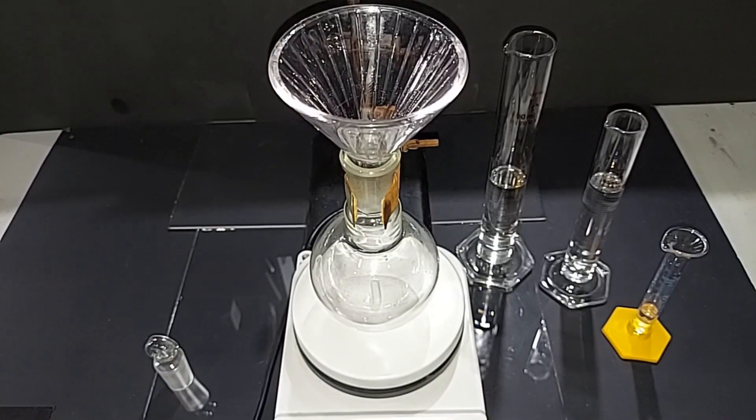Our very first order of business is to mix our three ingredients. I have this set up like this because I wanted to be able to use a magnetic stirrer, especially for the sulfuric acid, because it can mix with some of the water and the ethanol, and it can create hot spots. So you want your sulfuric acid, which I'll be adding last, to mix as quickly and thoroughly as possible to prevent those hot spots. Also, there's no heat being applied here, so no esterification can occur really. If it does, it's at a very low rate. You can pre-mix these and leave them up to 12 hours or overnight without a problem as long as you cap this to prevent any evaporation.